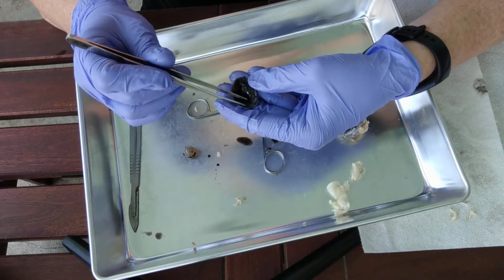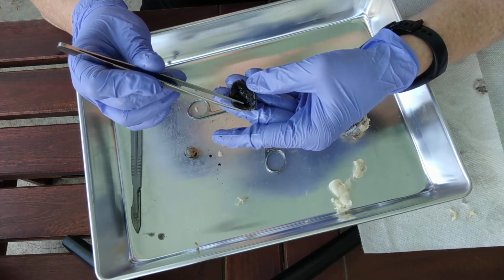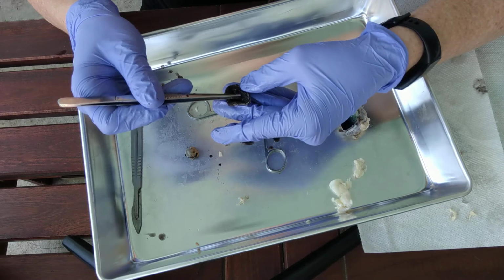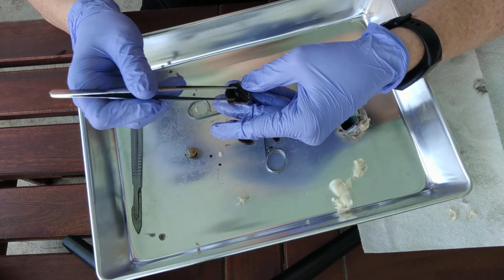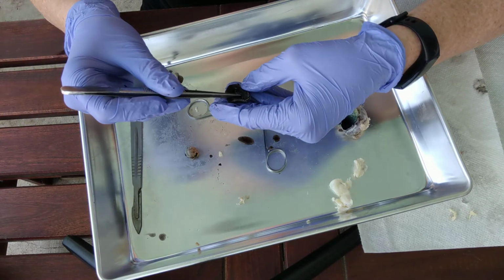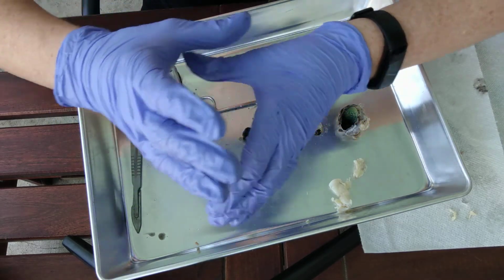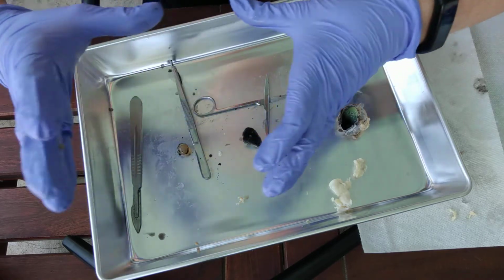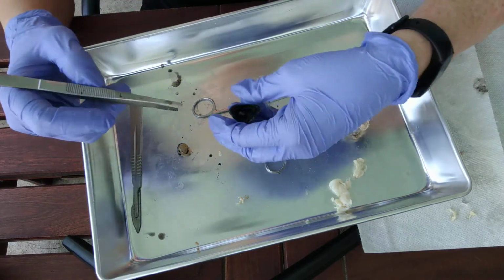Okay, so the ciliary body is, again, the structure that looks like the underside of a mushroom. That's the ciliary body, and it goes all the way around. Then anterior to that is going to be a little flap. That is going to be the iris. What's the function of the iris? The iris controls the amount of light that enters the eye. It has little muscles in it, and it'll constrict or dilate to change how much light goes in.